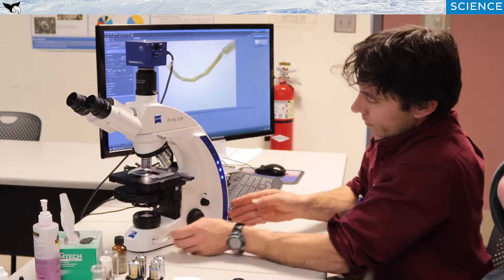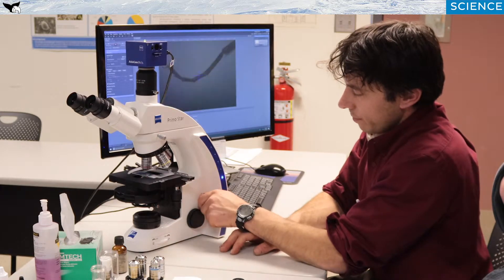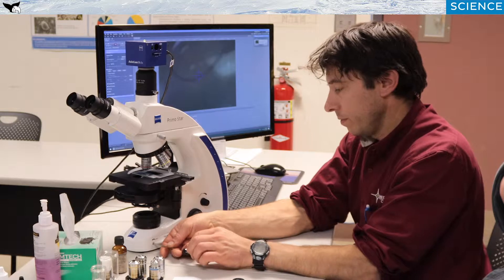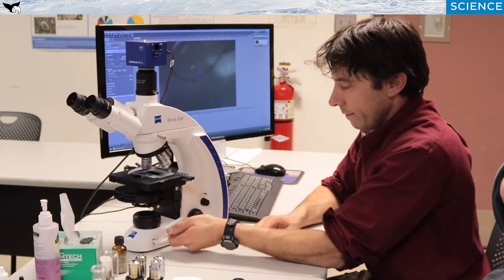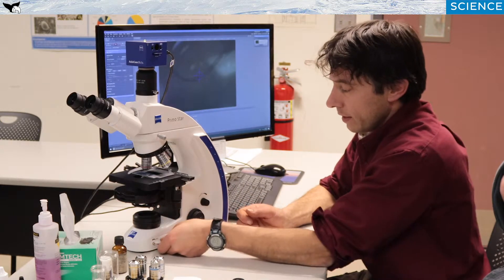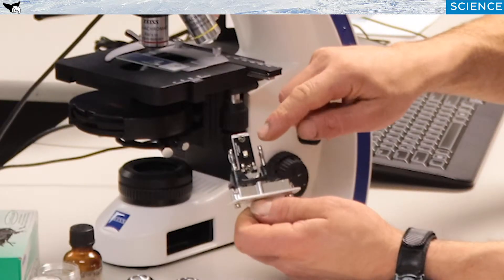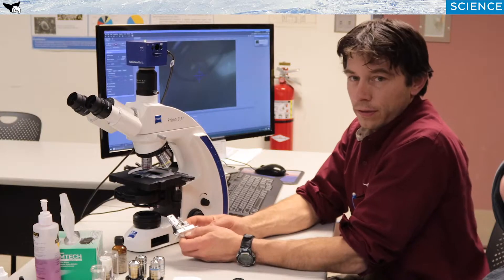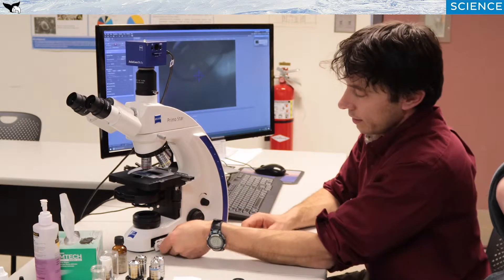There'll be some place along the microscope, either in the back, or directly underneath this area, in which you'll find a light bulb, or in this case, on this microscope, an LED. One of the problems people run into all the time is they'll turn on the on off switch, and no light will come through the system. Sometimes your bulb is burned out. In this case, we have a small LED here, and it could be also a light bulb here that might need replacement. LEDs typically will not need replacement. If they're not functioning, it's usually something in the circuitry itself, and not the LED.